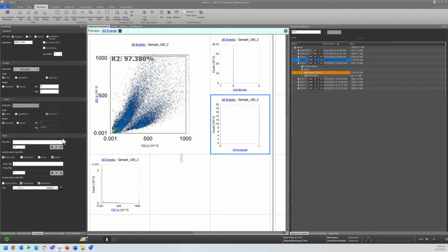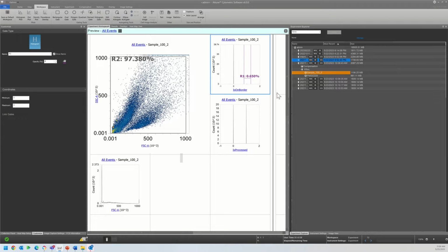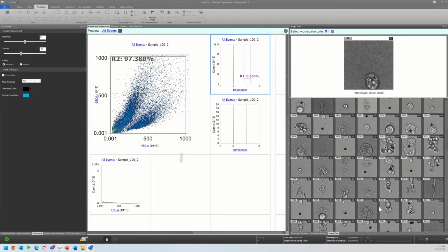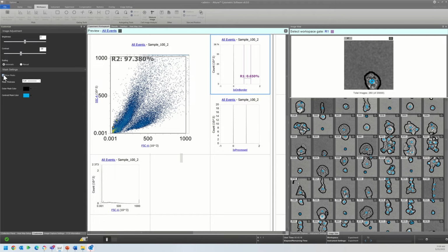So all I'm doing over here in the Customize tab is changing the min and max range of the scale so we can all see it a little better. And let's start over here with is on border. So think of this as a binary question. Is it on the border, yes or no? So if we come over here to the image view gallery and we just look, most of these are on the border. I can turn the masks on so we can see.